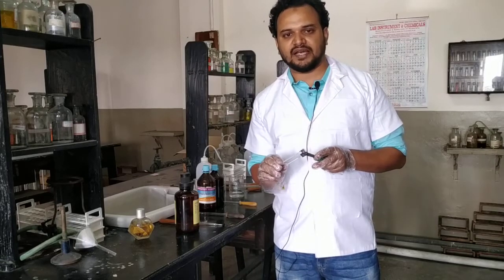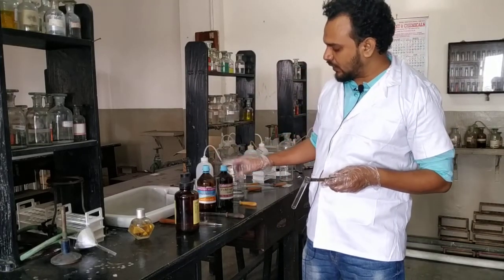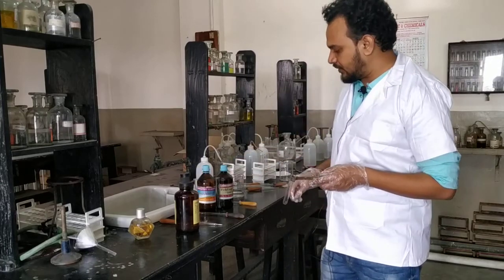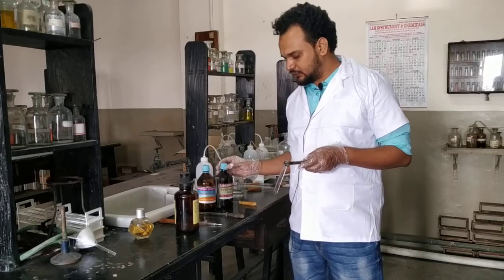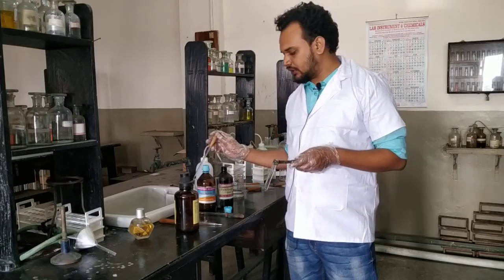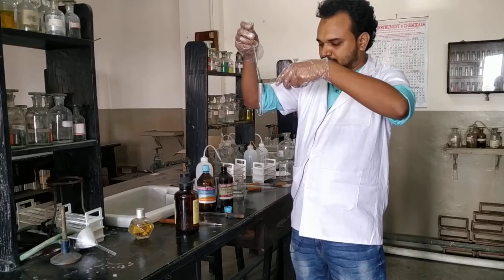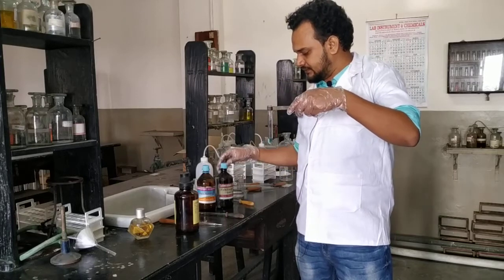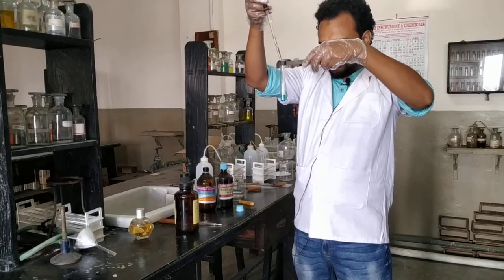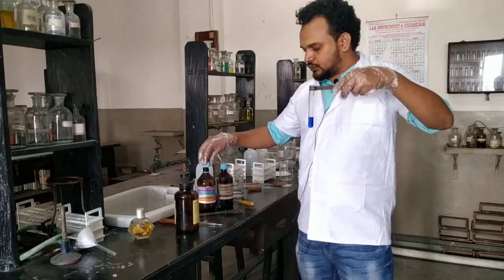Let us start with the Fehling's test. We have two solutions: Fehling's solution one and Fehling's solution two, and we have formaldehyde, which is an aliphatic aldehyde. We mix almost equal volumes — you can estimate by perception. I have taken Fehling's one and then added almost equal amount of Fehling's two. See the solution becoming deep blue — a deep blue solution.